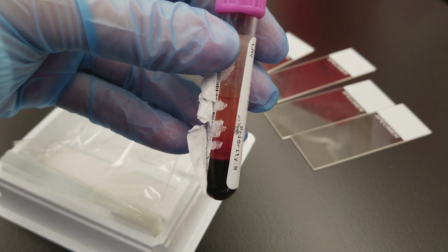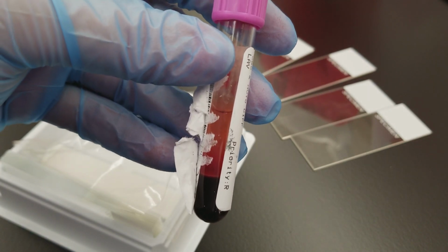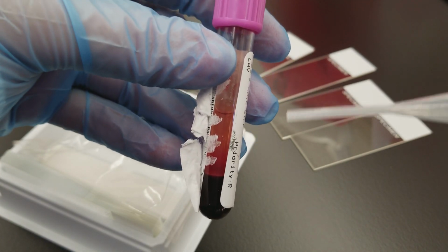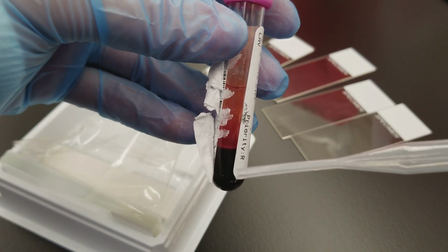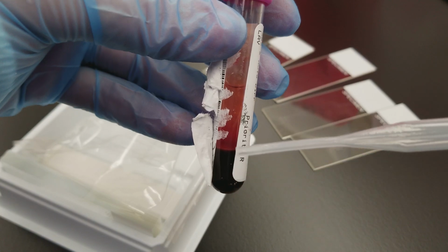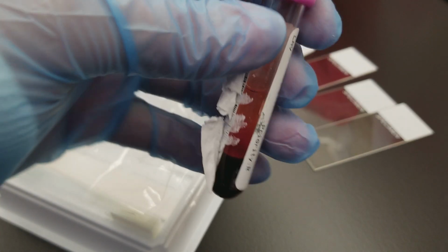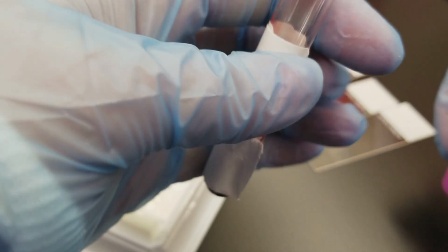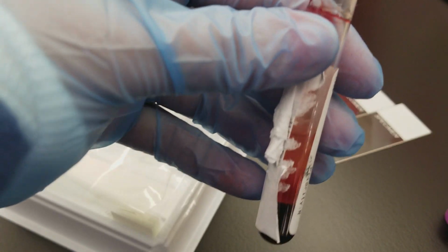When you get this kind of tube in the lab, it should be completely resuspended; it should not have settled like this. But if it has settled, you can look at the hematocrit right here, which is just the settling of all the cells, to judge whether it's low or high. This one seems fine, and it's always in relation to the amount of plasma that's in the tube.